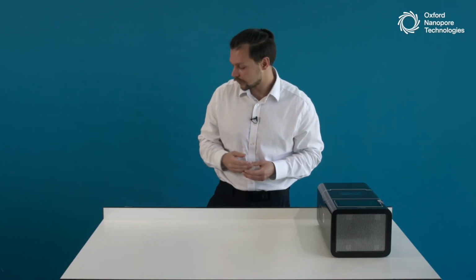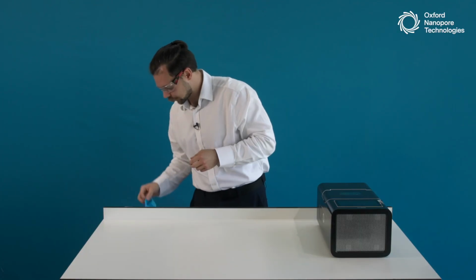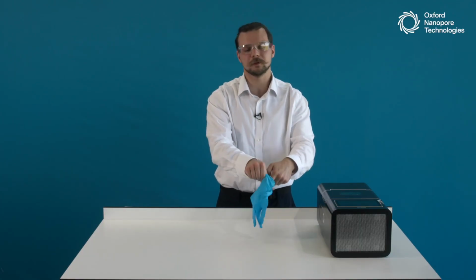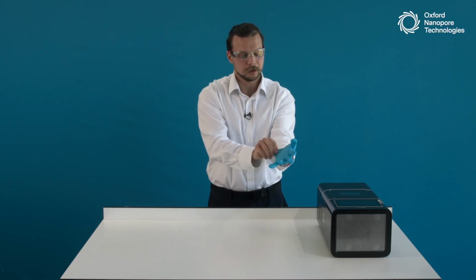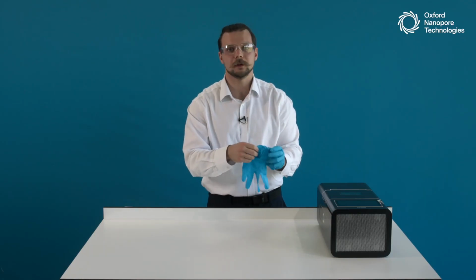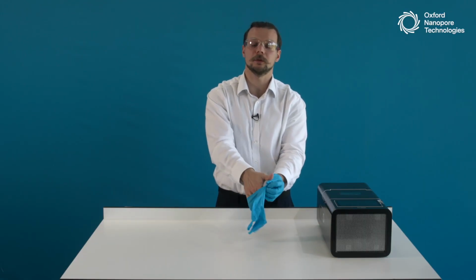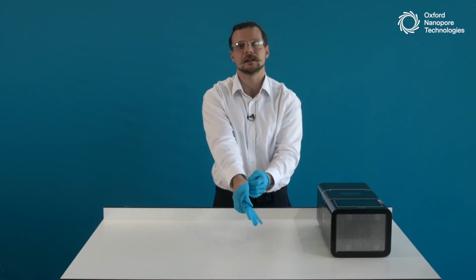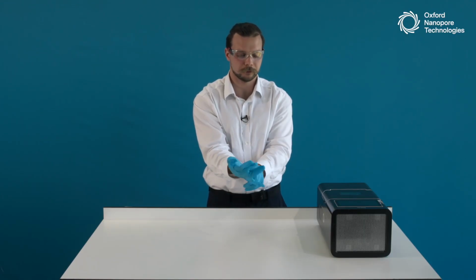Okay, now that I've said this, I will go on and follow my own advice, put on my safety specs and gloves before we can proceed with loading the PromethION flow cell. Now, I will run through the PromethION flow cell loading first, and then after this section, we will actually do them with the demo packs that you have as part of this London Calling 2025 conference.